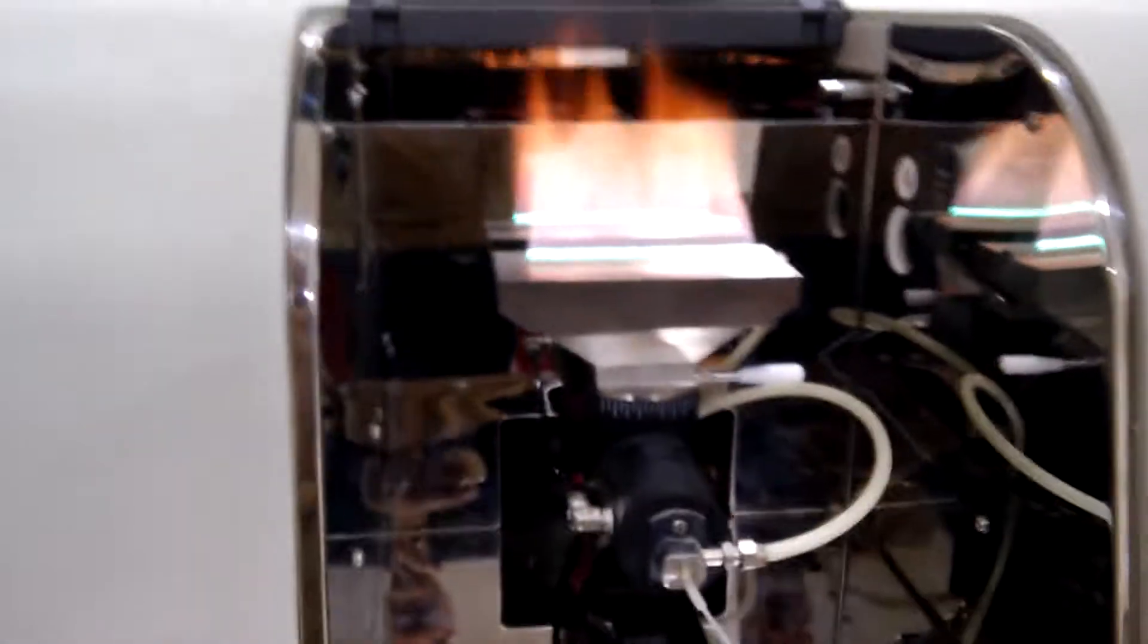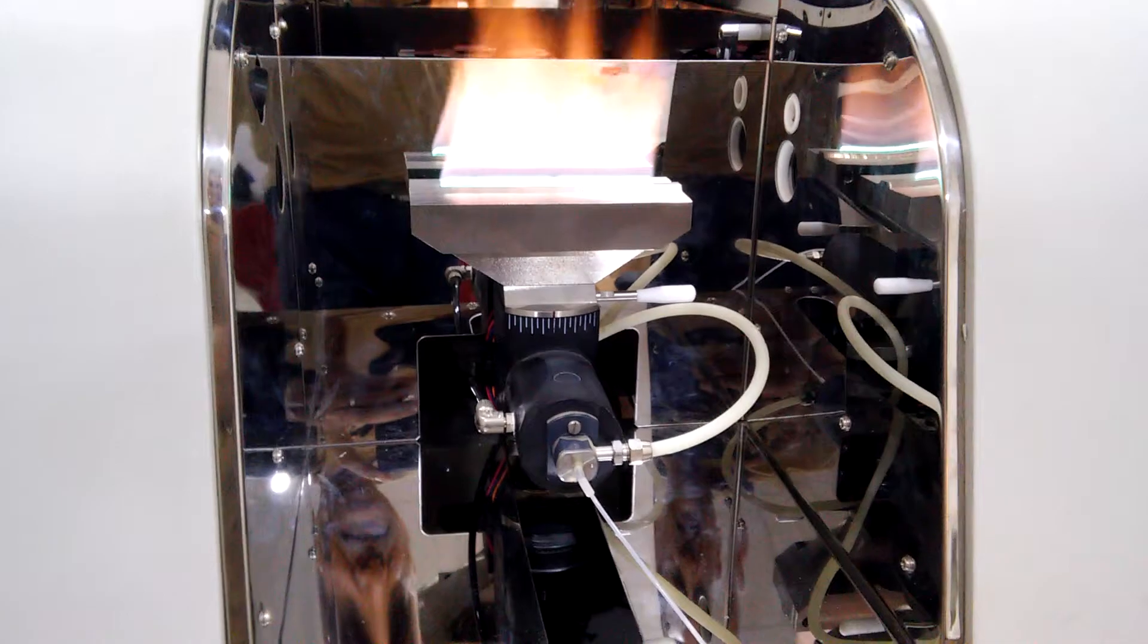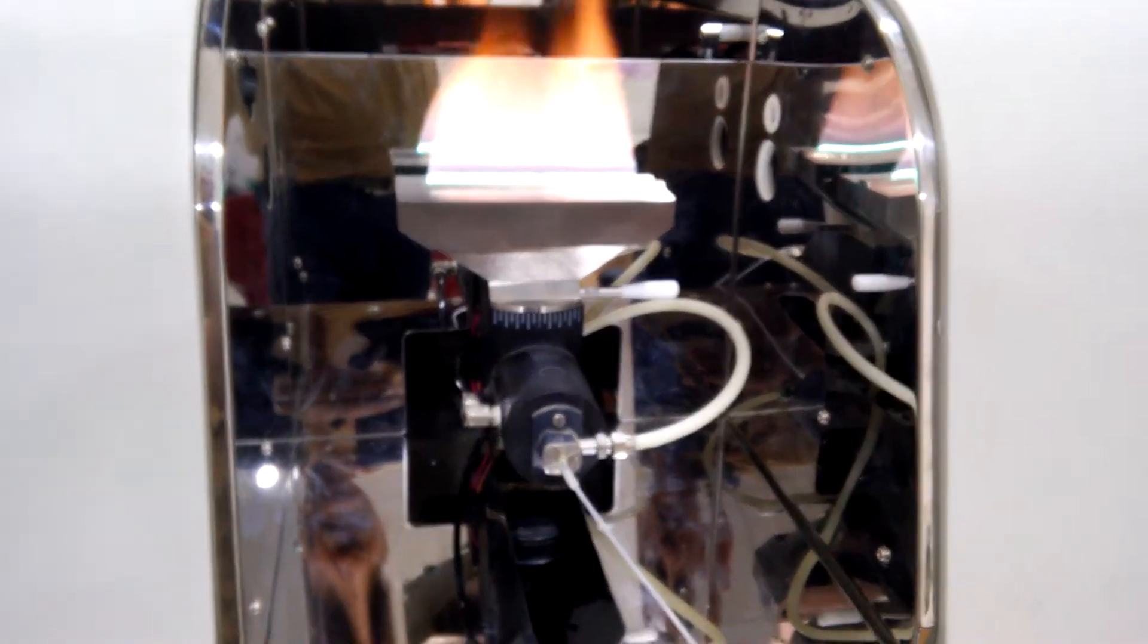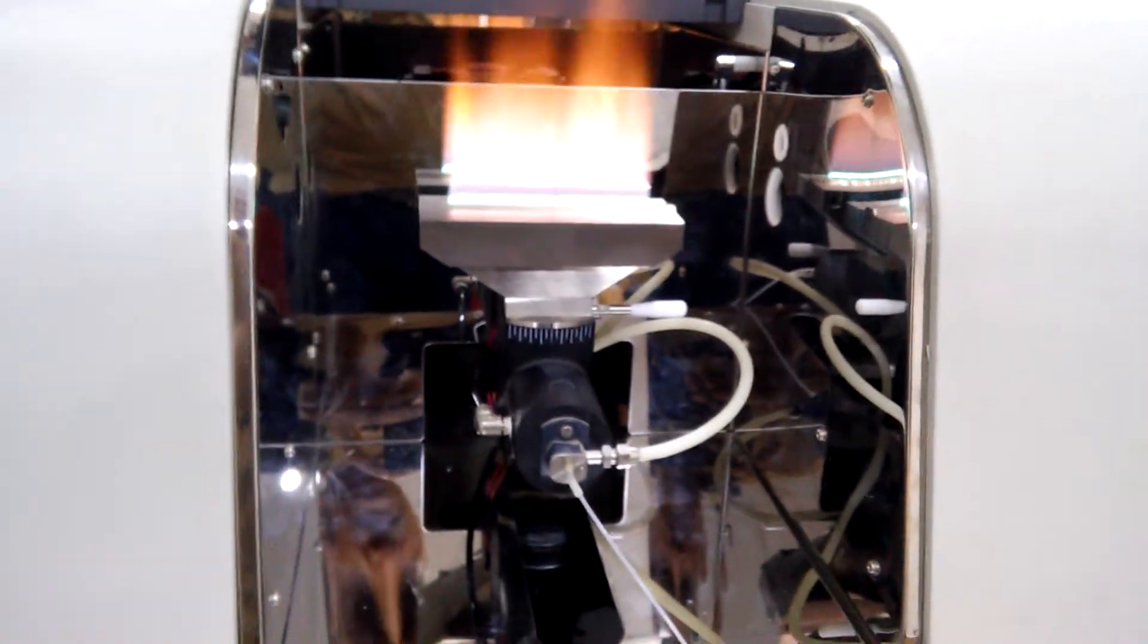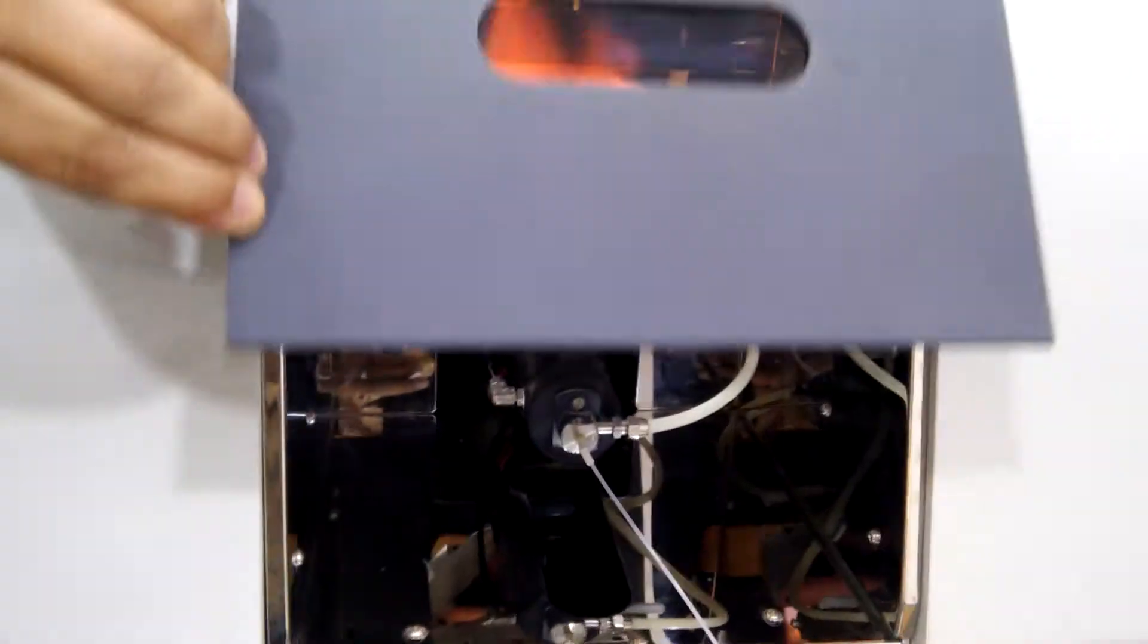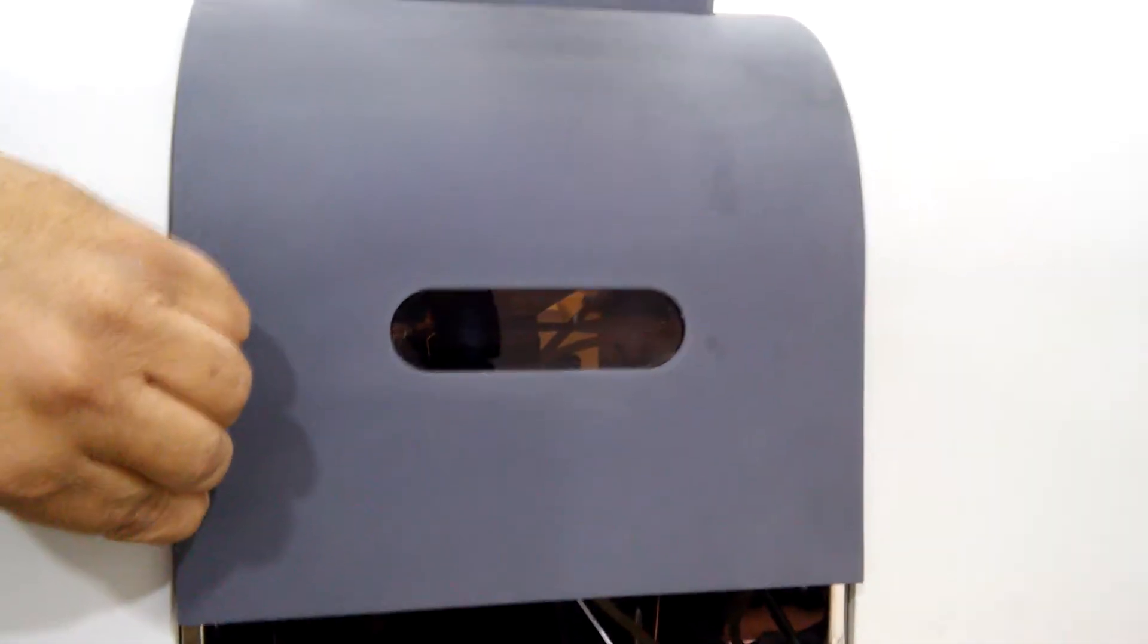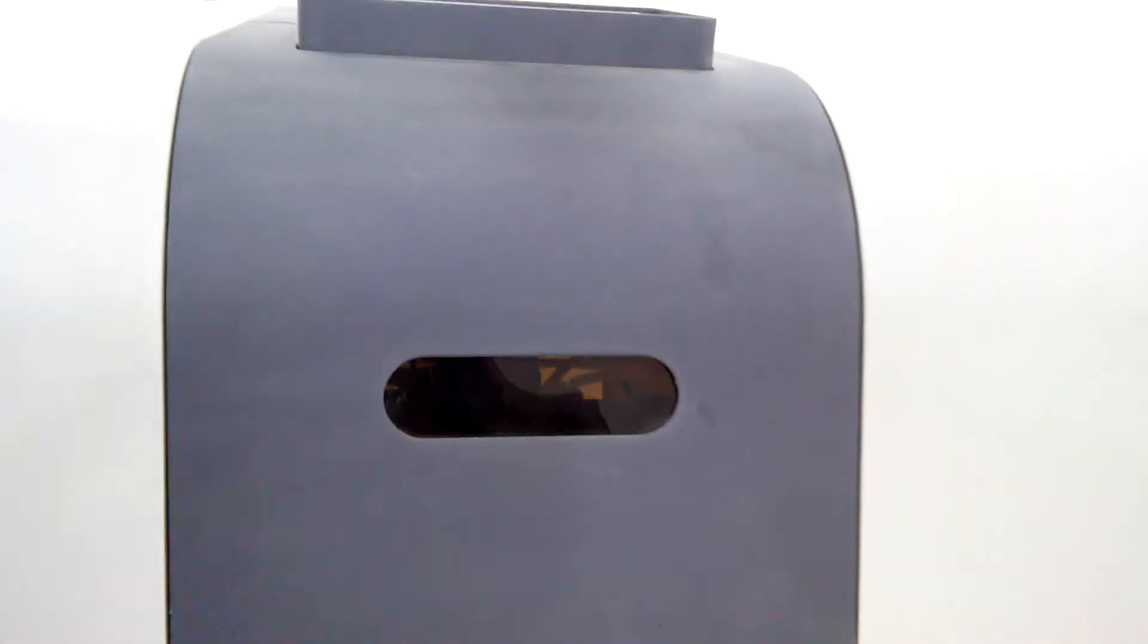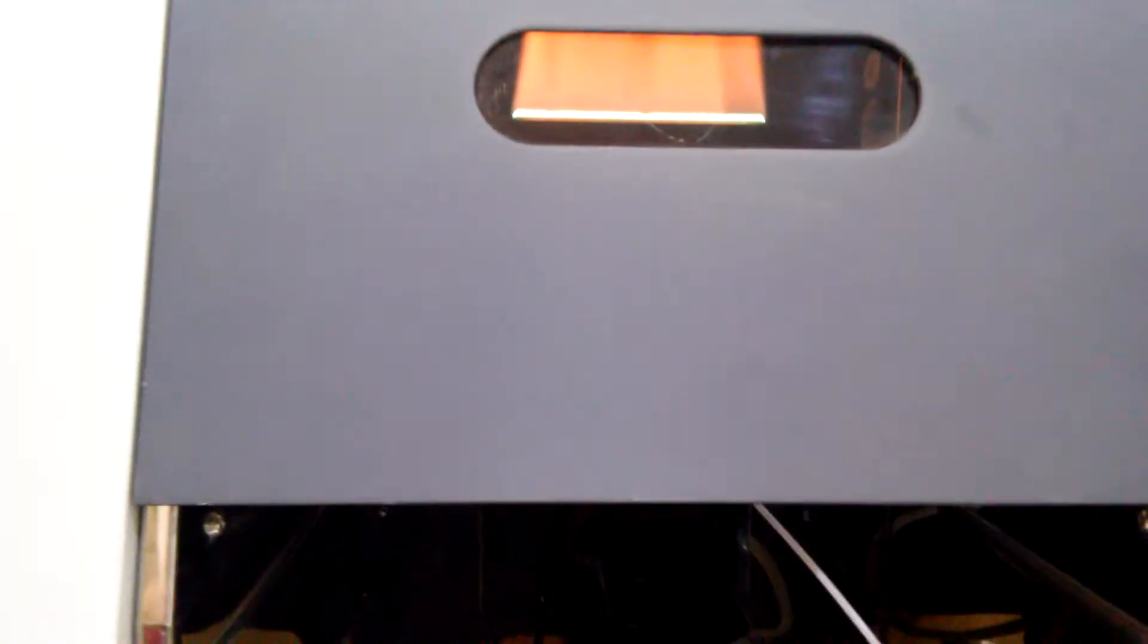This is good. Let's see what's going on inside the instrument, but there is no need to open it. It's for your safety and now everything is okay.